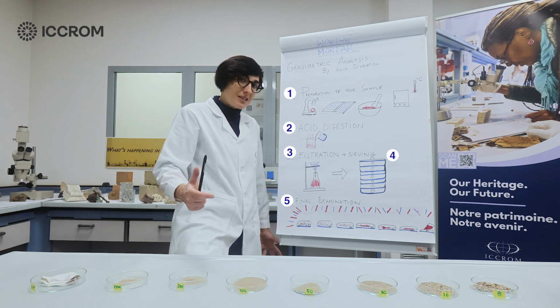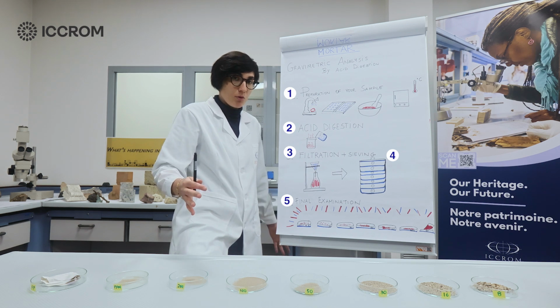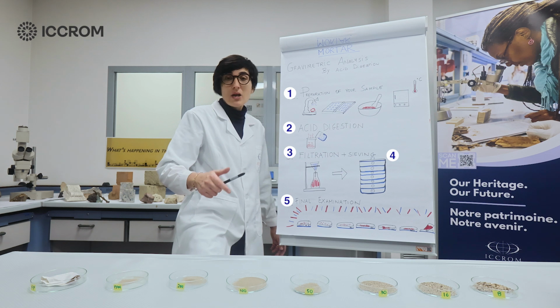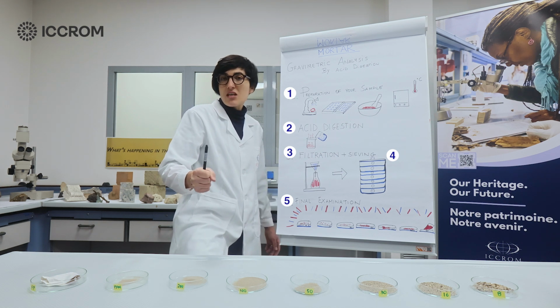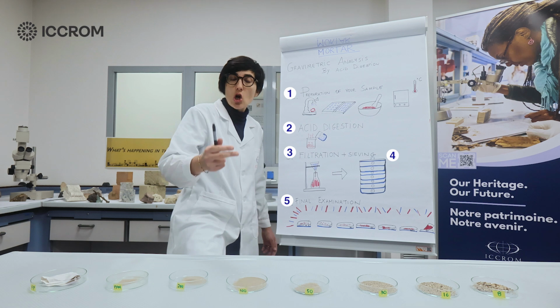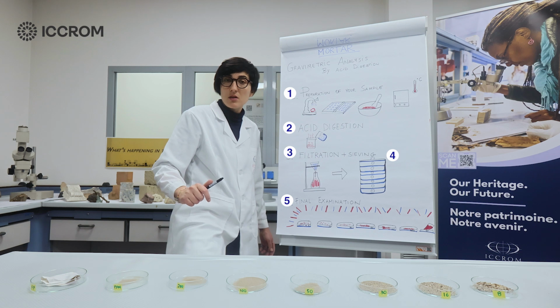This test can be particularly useful if you're working with a large population of samples that you believe to be of similar composition. You can quickly gain information on the aggregate type, grading distribution, color, appearance, and also it will quickly allow you to make comparisons between different samples.